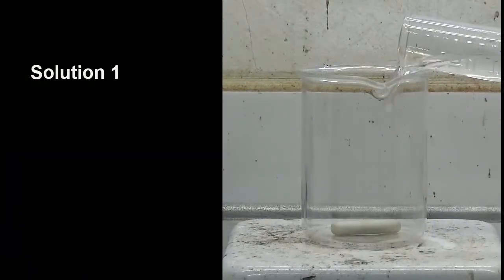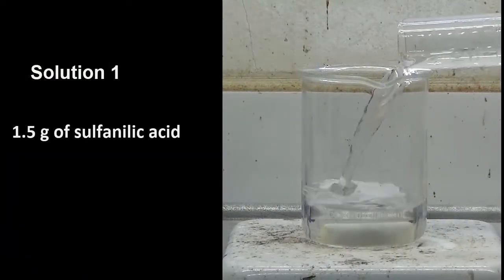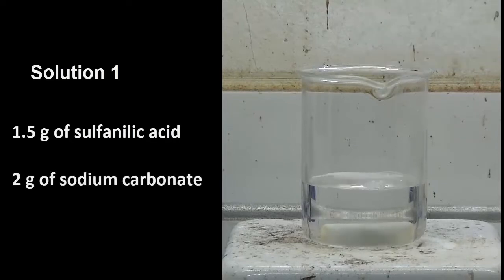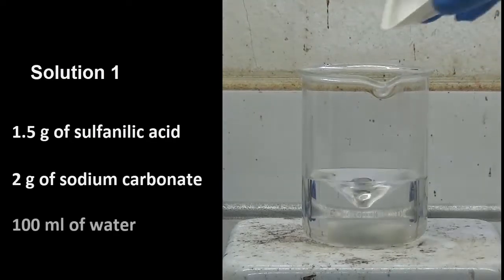Solution 1: Dissolve 1.5 grams of sulfanilic acid and 2 grams of sodium carbonate in 100 milliliters of water.